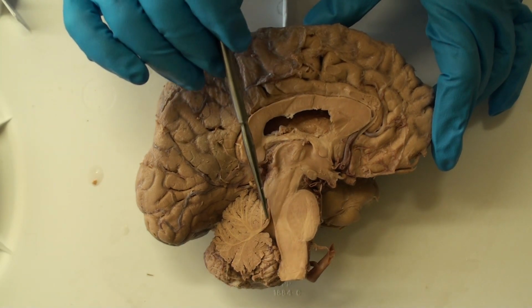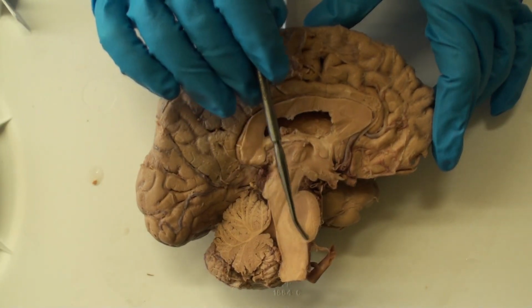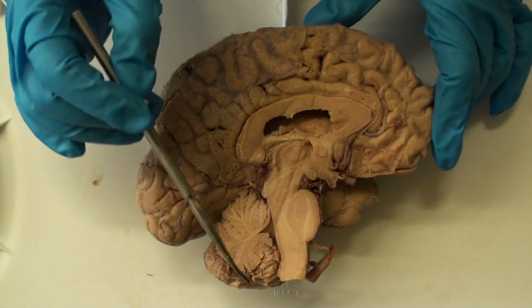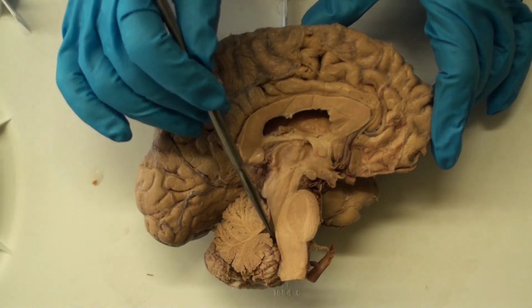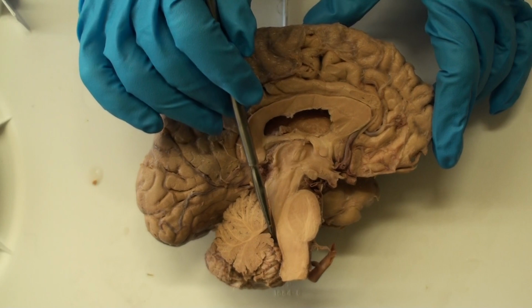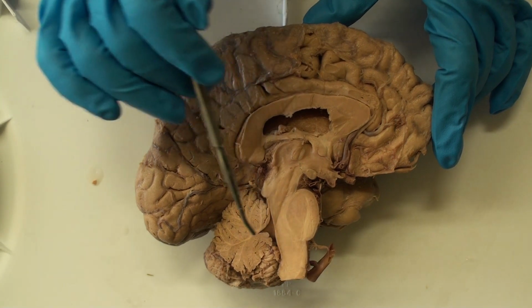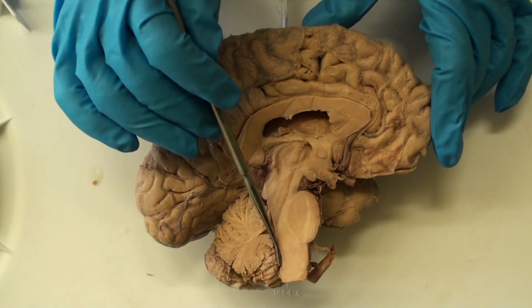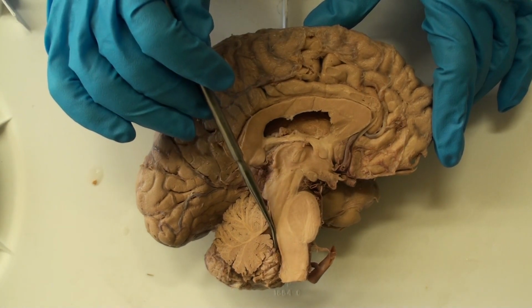If we trace the cerebral aqueduct down, we see a cavity which is between the cerebellum posteriorly and the pons anteriorly, and this cavity is the fourth ventricle. And so it has sort of a rhomboid shape to it. And there are 3 openings out of the fourth ventricle. Laterally, two foramina called the foramina of Luschka. And so you can remember that because Luschka starts with an L and it's lateral. And there's a foramen right in the midline, so you can see part of that foramen, half of it, and that's the foramen of Magendie. And remember that because Magendie starts with an M, which also, midline starts with an M.